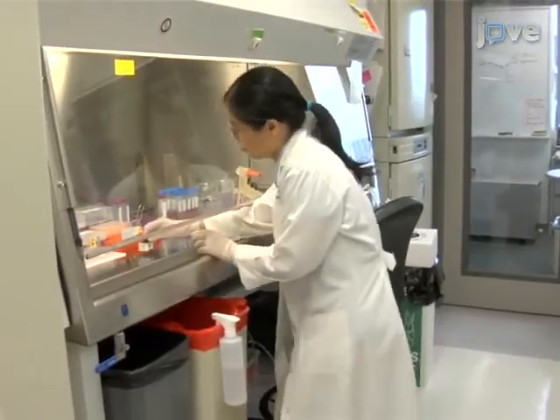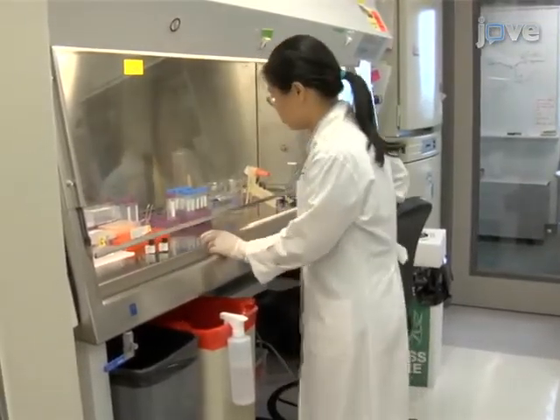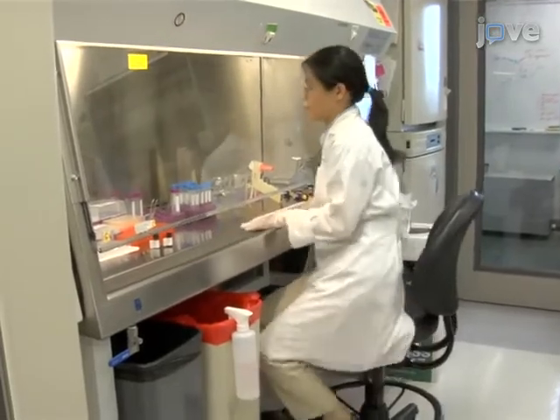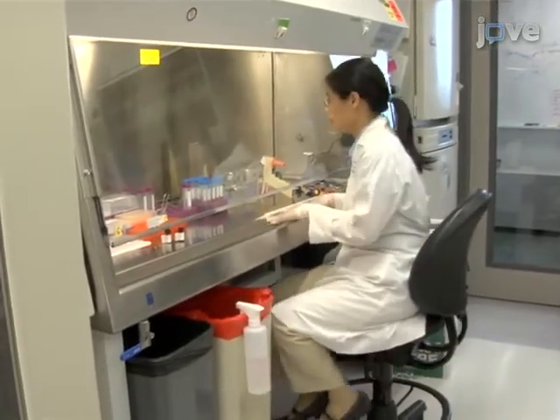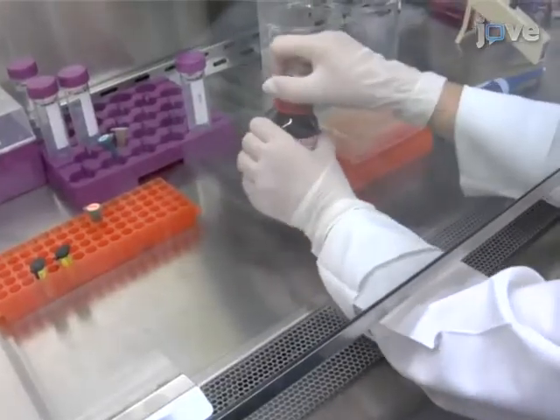Carboxy H2-DCFDA is non-fluorescent, but in the presence of reactive oxygen species, this reagent is oxidized and fluoresces green.